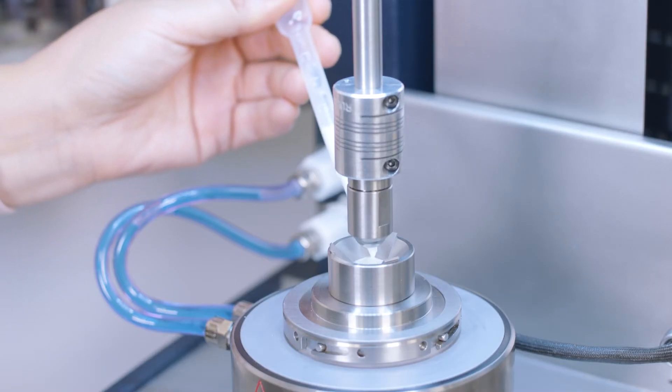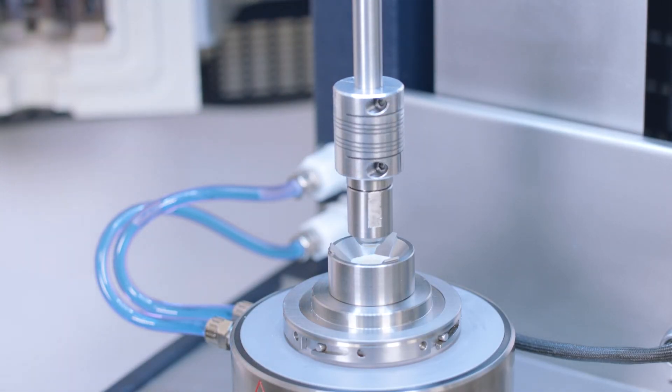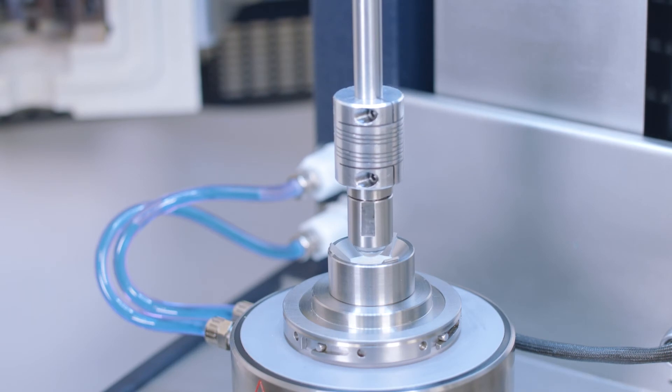After that, load your testing media. Lower the upper ball until it is in contact with the bottom three plates.